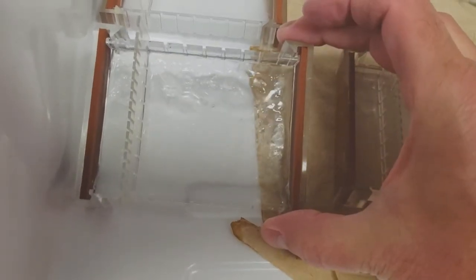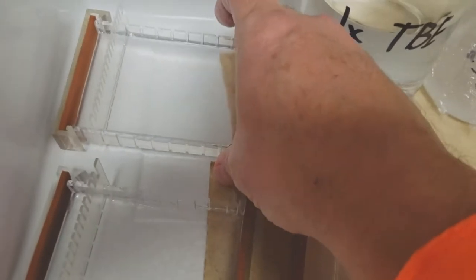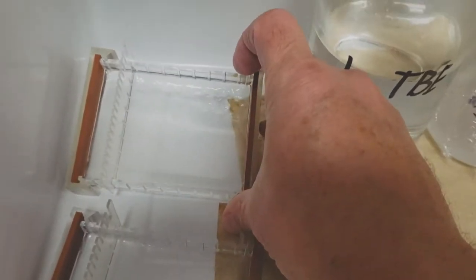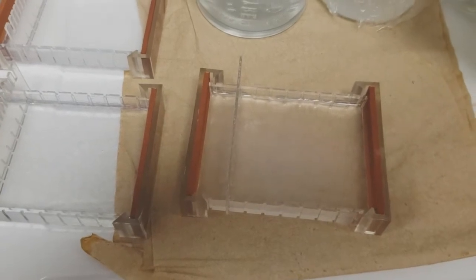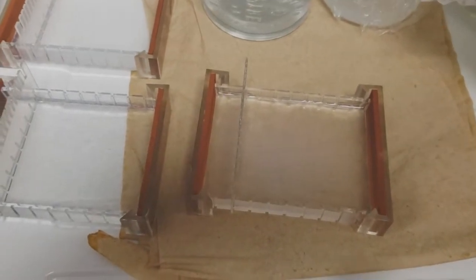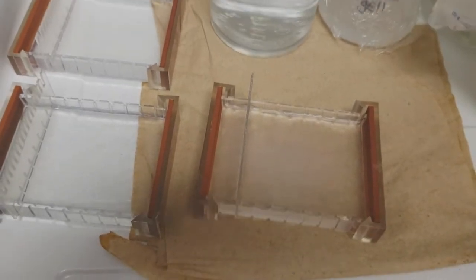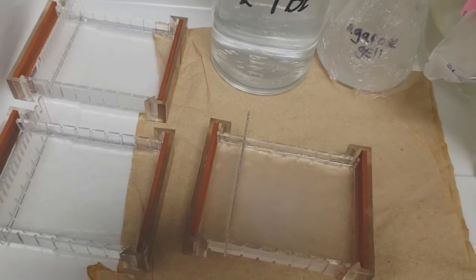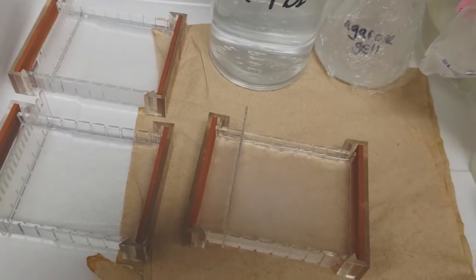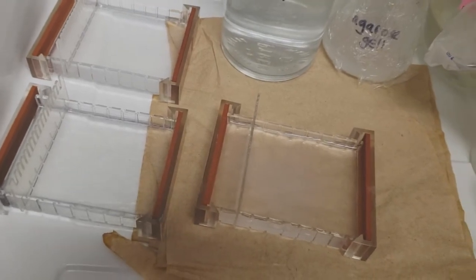We made up a solution, and my guess is we made it too dilute because it's not setting up. It's not gelling. Perhaps I didn't boil it. I'm gonna take that and boil it and see what happens, and then see if it'll set up into a solid, and then I might try this again.